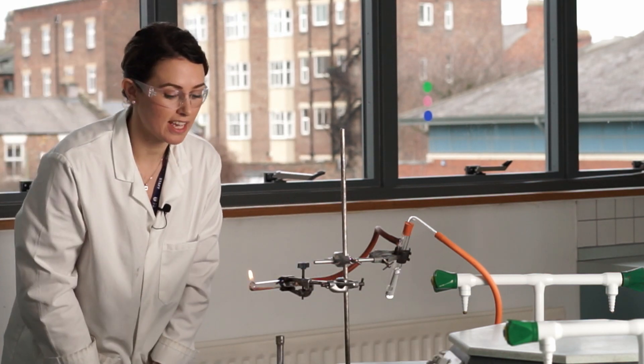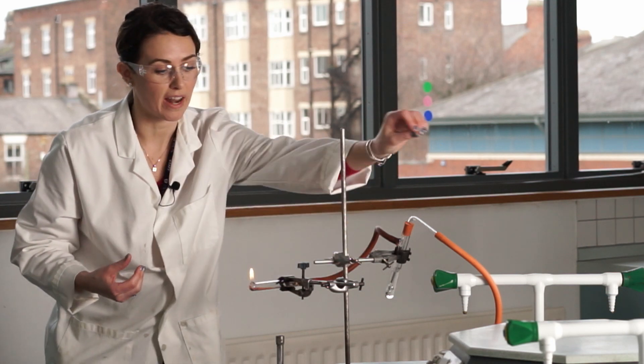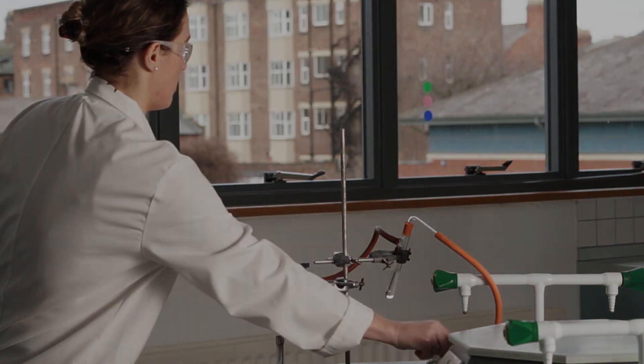Because of this lit gas here, I don't want to turn off the gas because it will draw the flame through the system. So I need to blow this out. And then I'm going to turn off the gas.